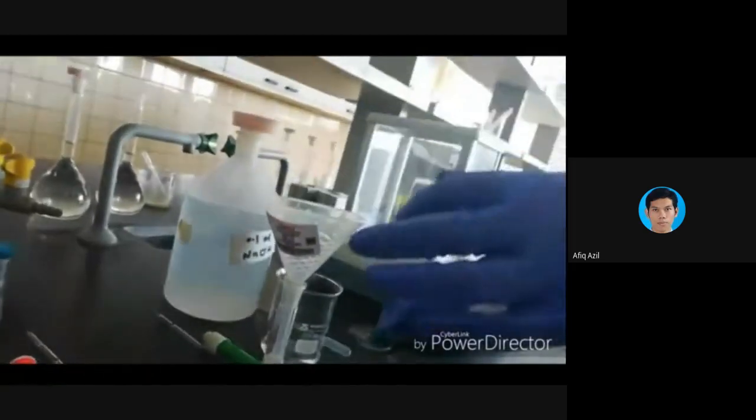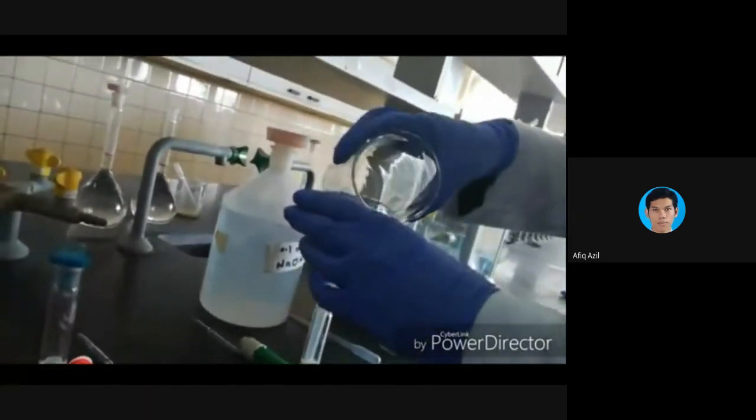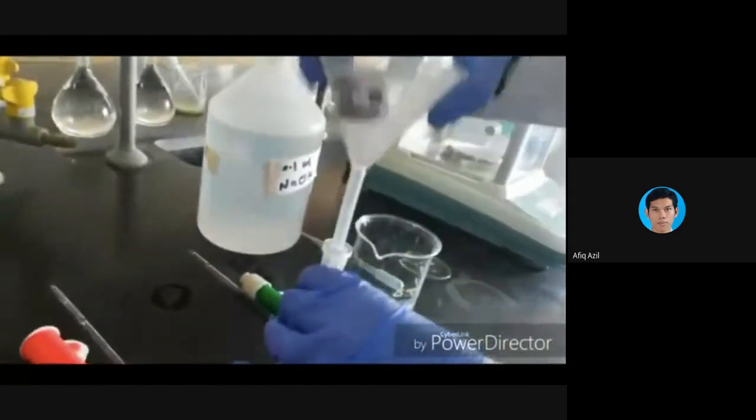So she is using a little bit of sodium hydroxide to help to dissolve the paracetamol. Okay, but in our manual, our procedure, we use a little bit of ethanol or methanol, and shake so that all the powder dissolves.